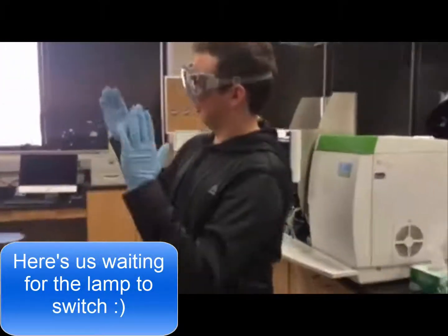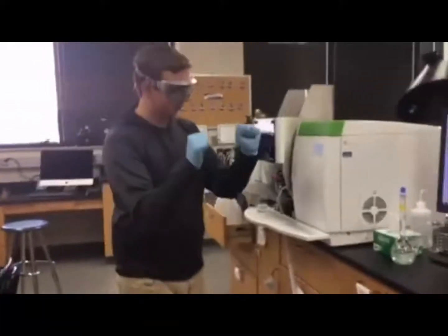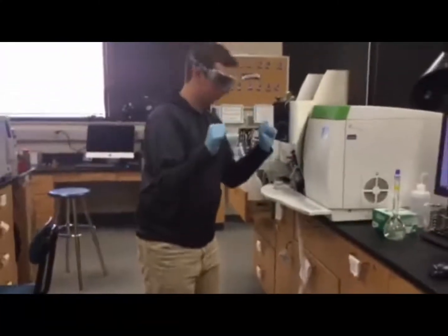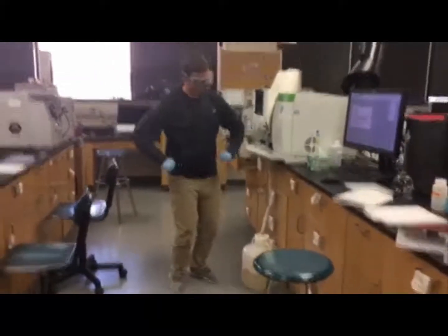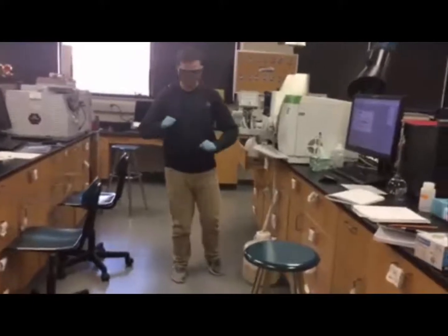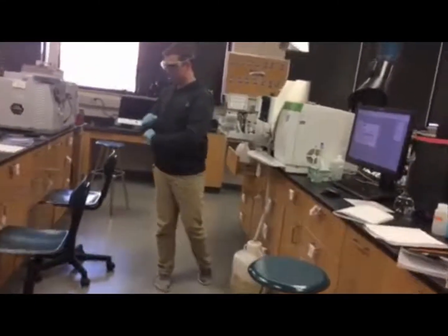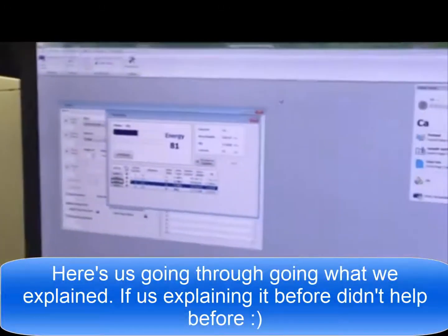Me right now. Oh, we've got energy. Okay, so now the lamp's turned on. So you can go out.